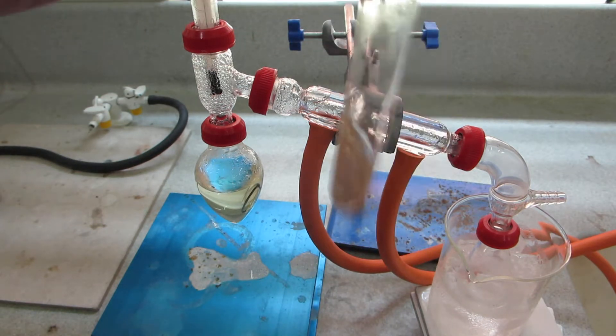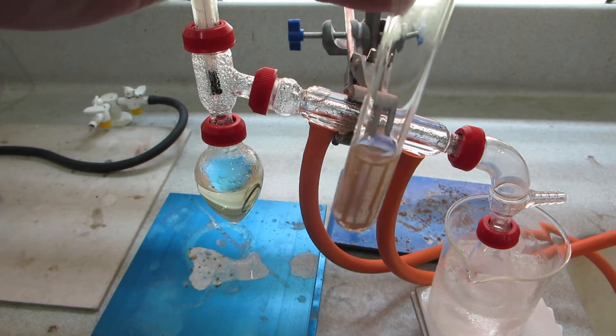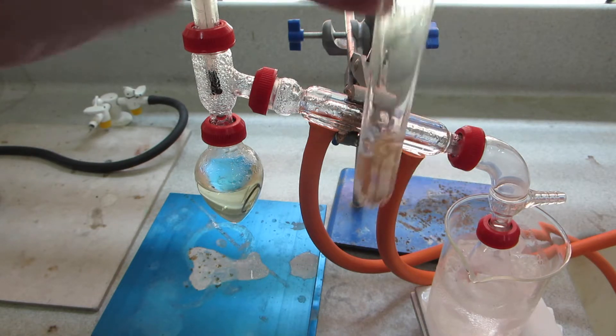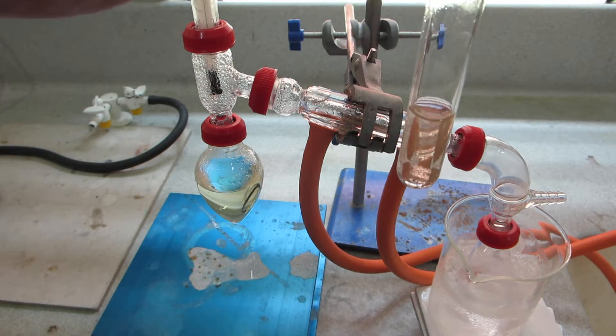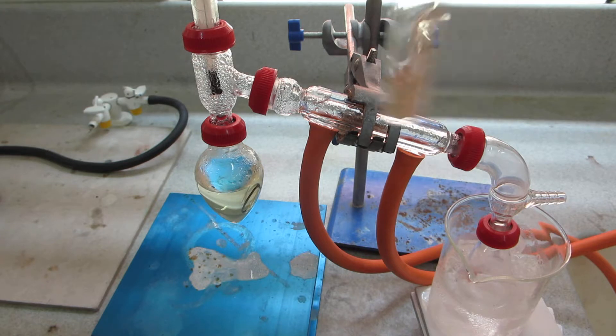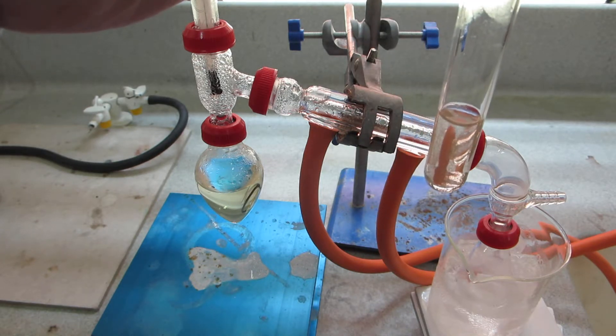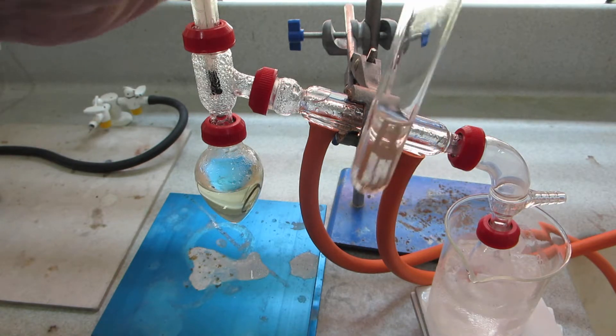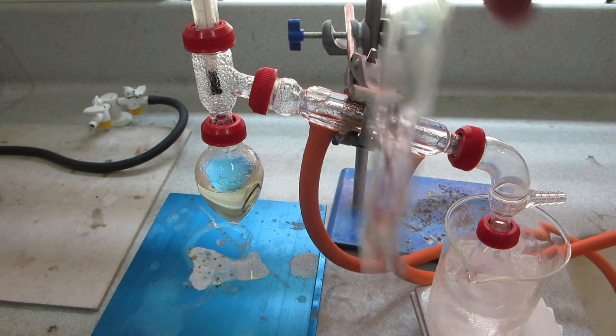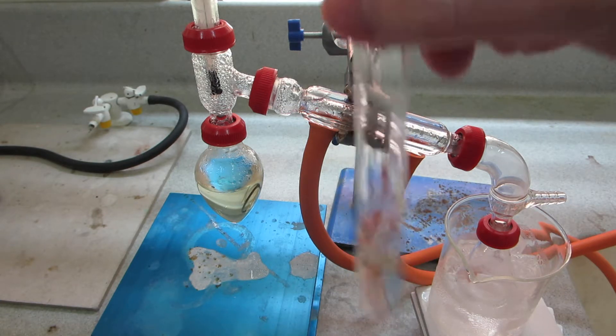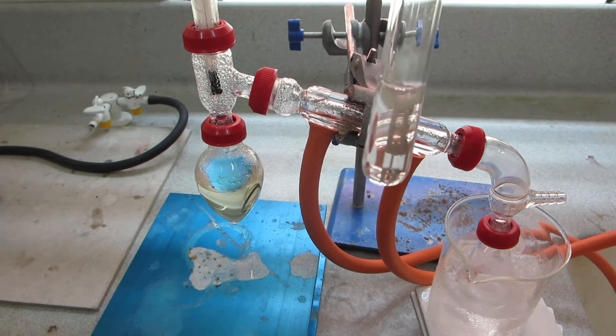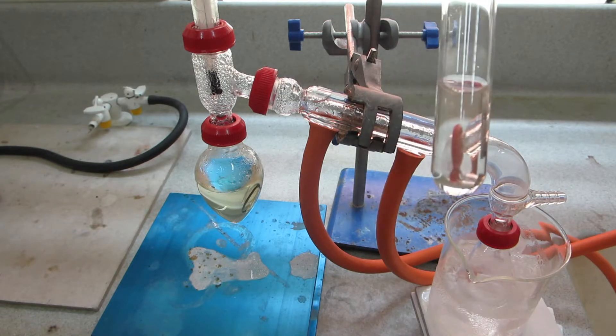It's dissolving now, you see it's mostly gone. And there, almost all just about gone.